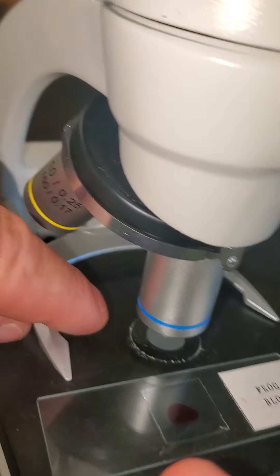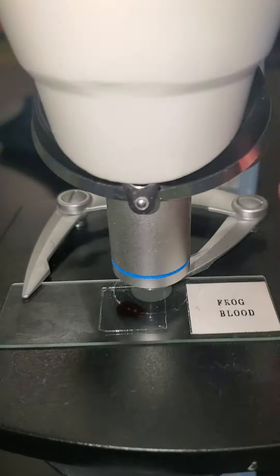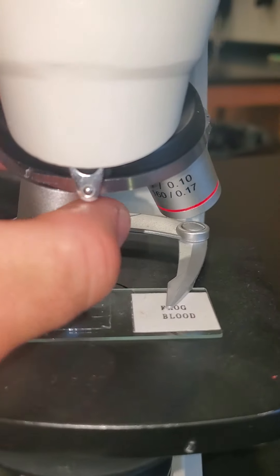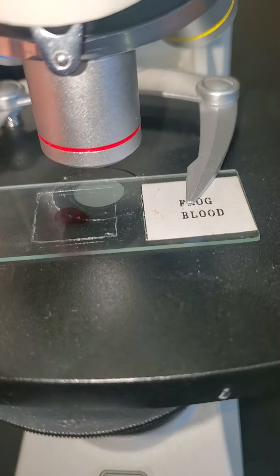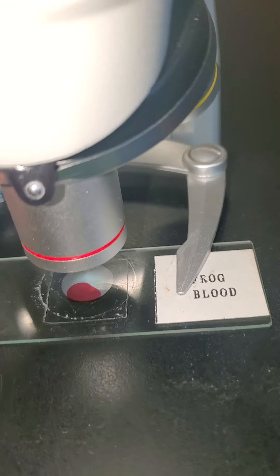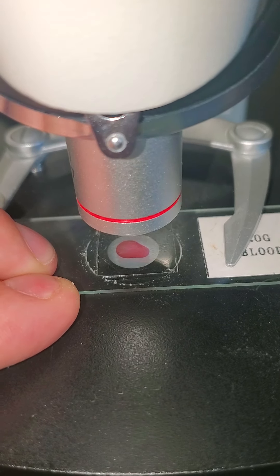We also have slide clips that we can put the slide underneath to hold it in place so that it doesn't move around. At that point there is a small eye opening there. I can turn my light back on and see that lit up, and we want to get it nice and centered in the middle.